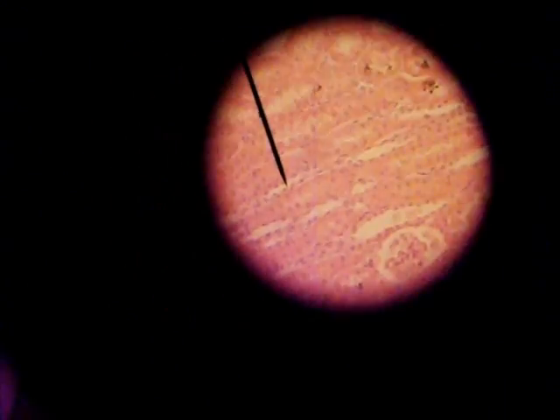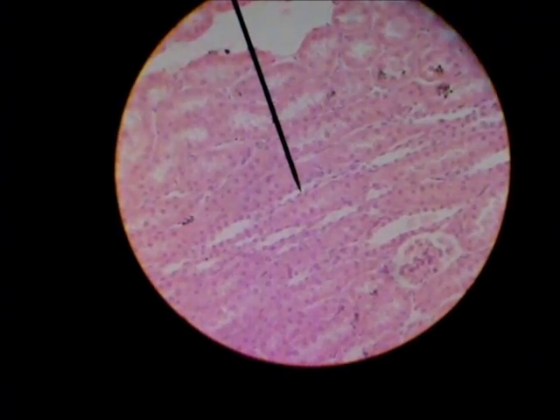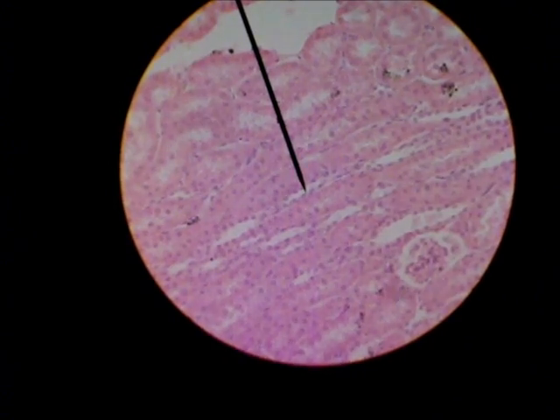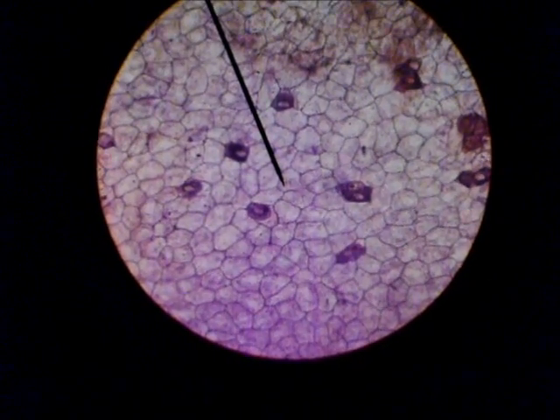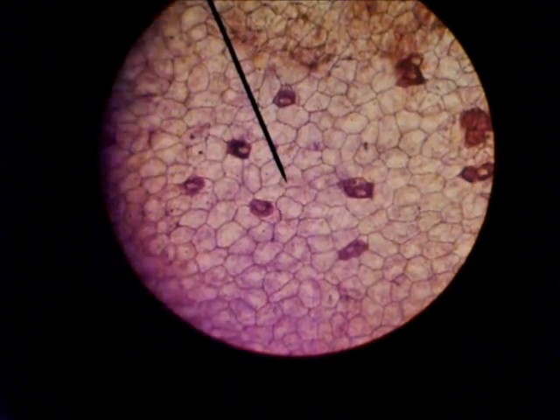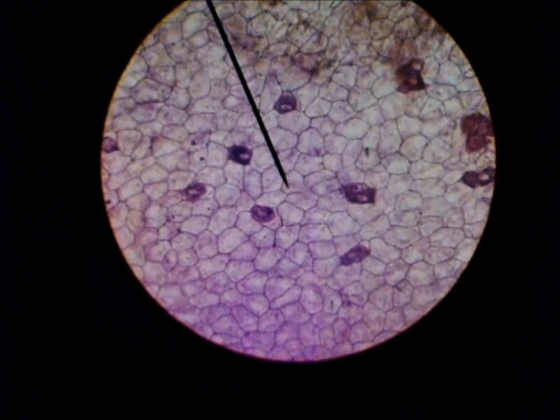Simple squamous epithelial tissue. Simple squamous epithelial tissue. This is simple squamous epithelial tissue.